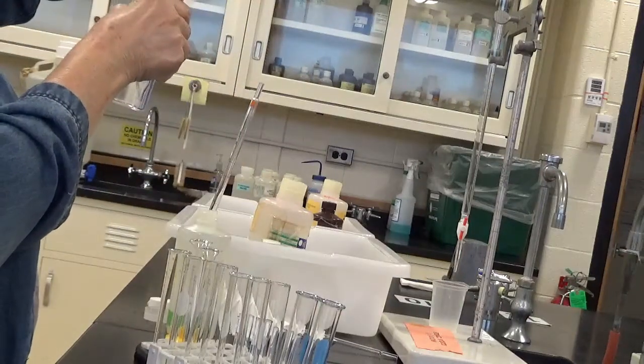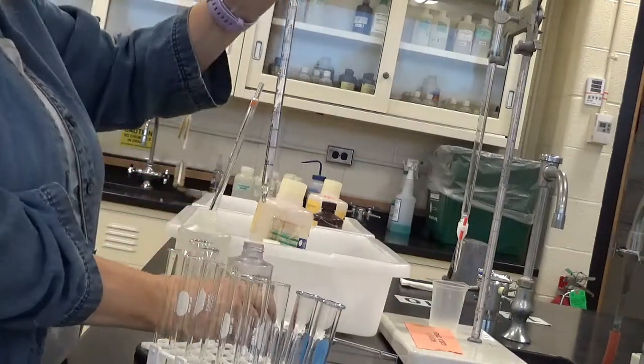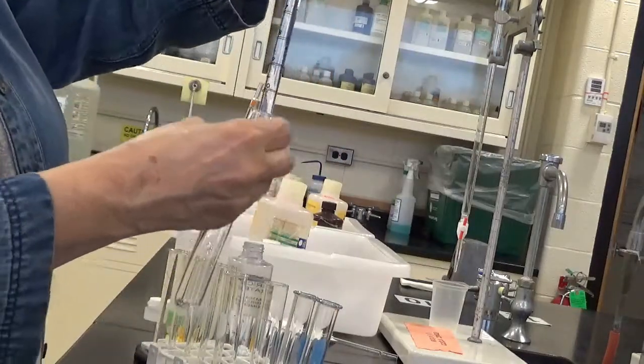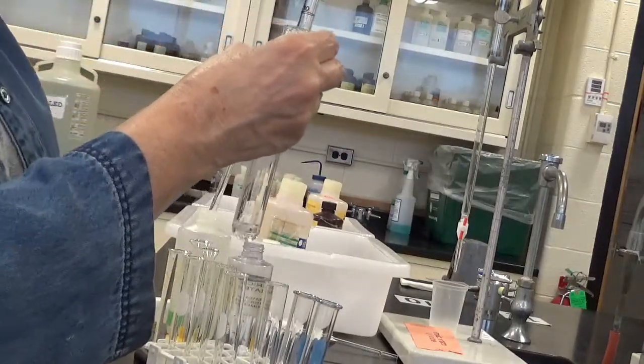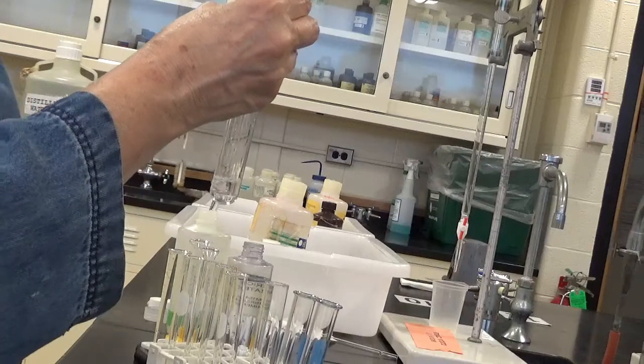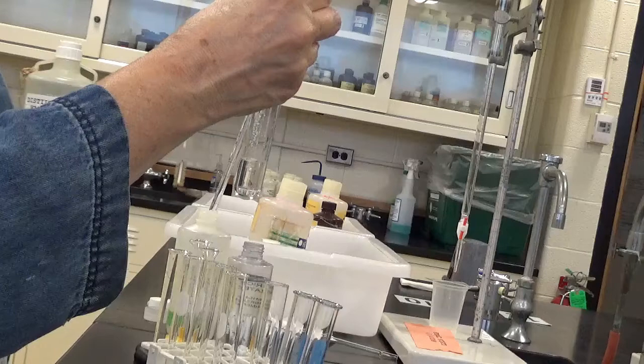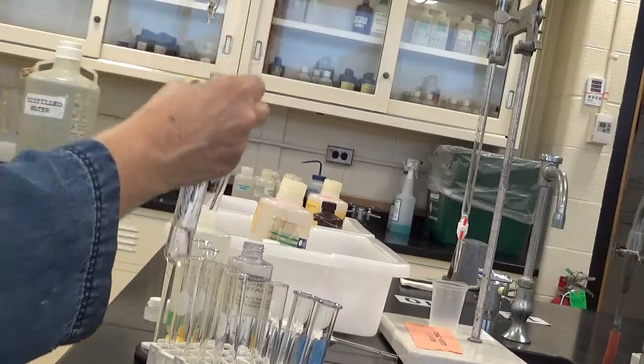I'm going to have to do more and more pipetting. 6. I put 6. 1, 2, 3, 4, 5, 6.